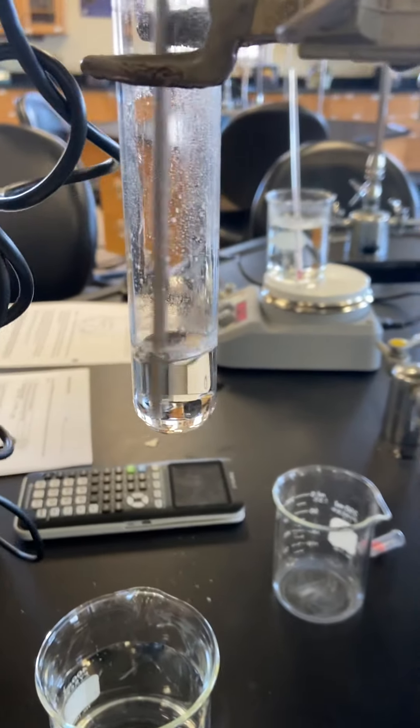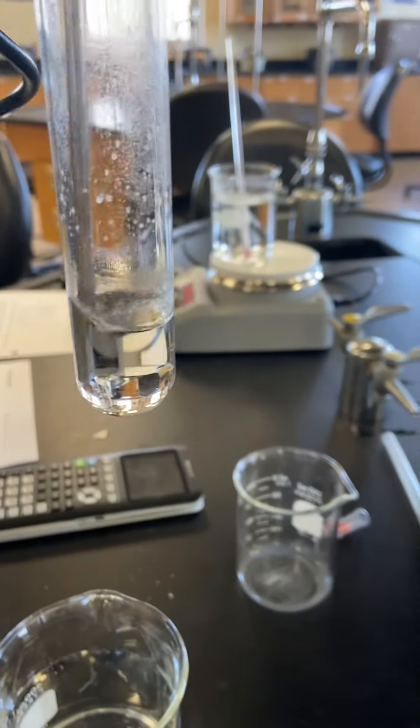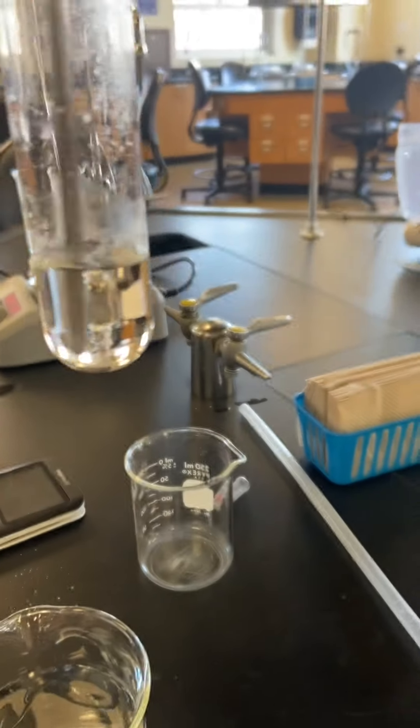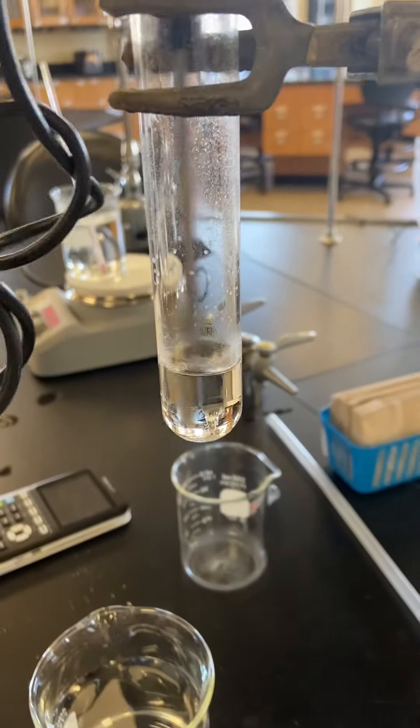This is lauric acid and it is melted right now at 44.6 degrees Celsius. We're waiting for it to freeze.